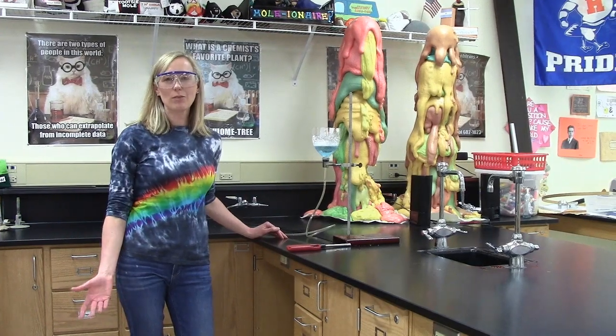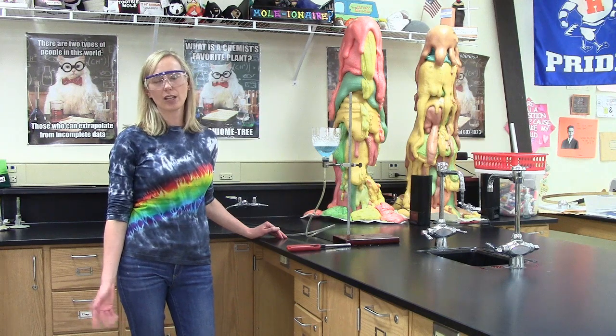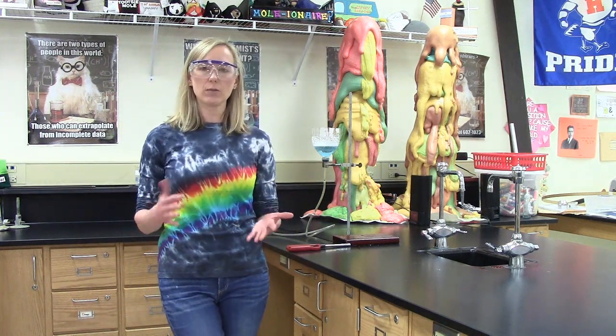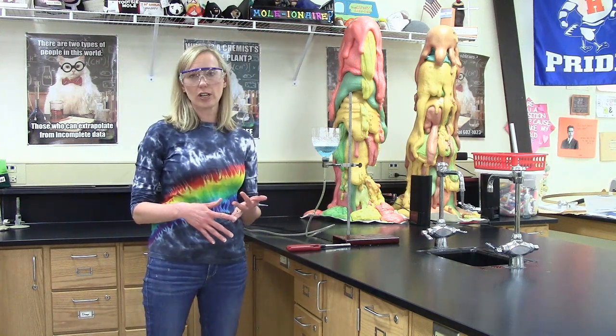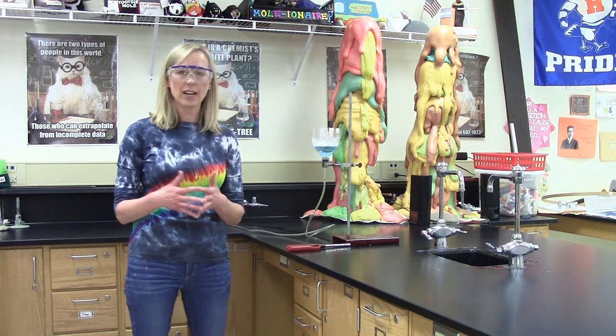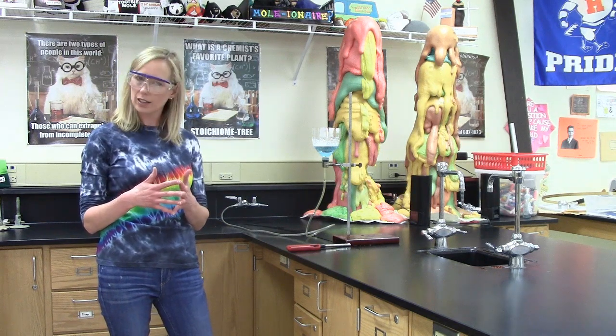In our next chemical reaction, I'm going to show you a combustion reaction. If you remember, combustion is where you take a hydrocarbon, a compound that is very rich in carbon and hydrogen, and burn it in oxygen just in the air. And we're always going to create carbon dioxide and water vapor. So it's a pretty easy chemical reaction to remember the products of.